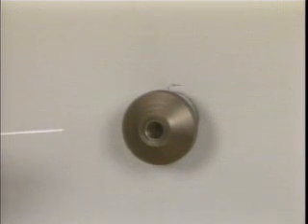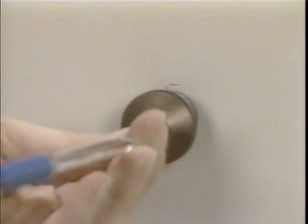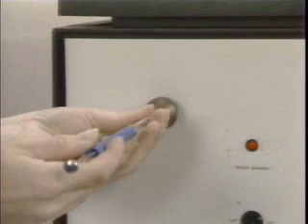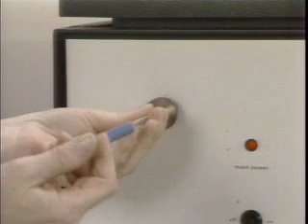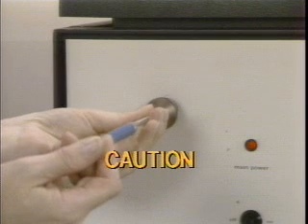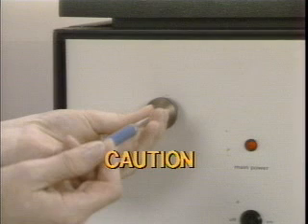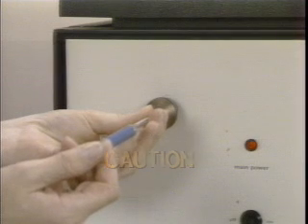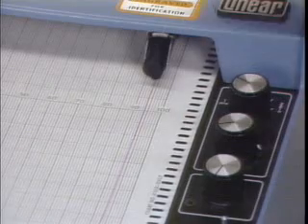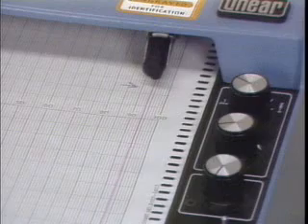Holding the needle tightly to prevent it from bending, it is pushed through the rubber septum of the injector port as far as possible to get the sample into the vaporization chamber. The plunger is depressed rapidly and smoothly. Always hold your thumb or palm on the plunger so that the pressure of the vaporized mixture does not eject the plunger. As the needle is withdrawn from the septum, the position of the pen on the chart paper at the time of the injection is marked.